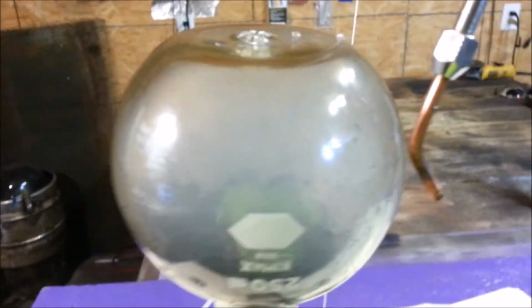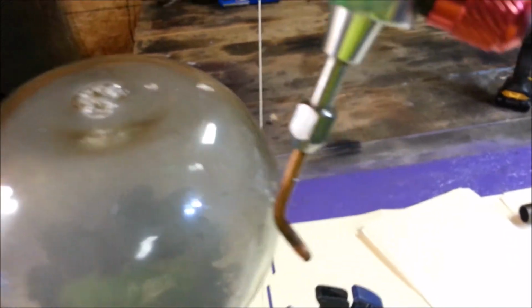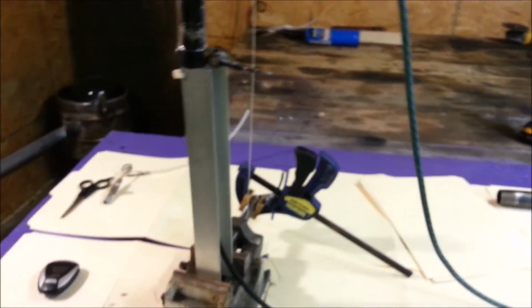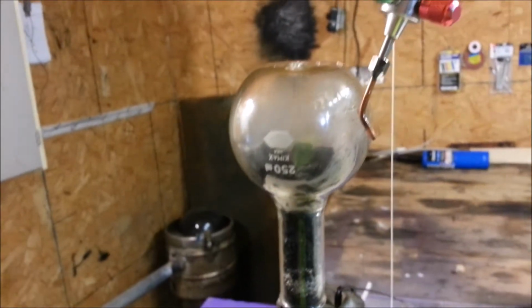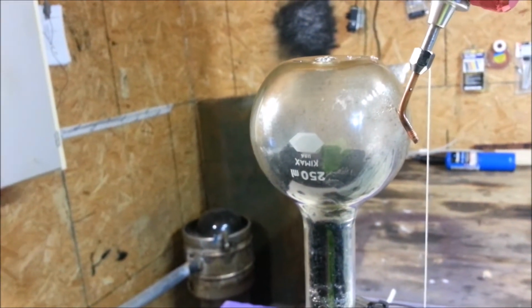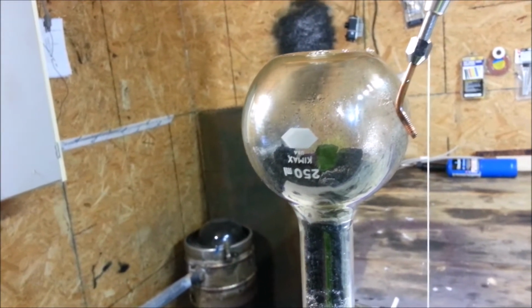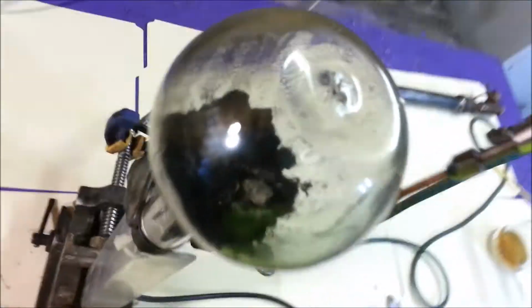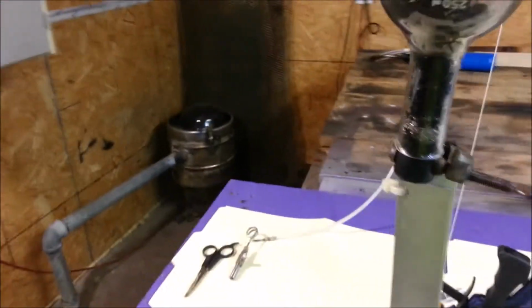So, this is showing some pretty interesting results as far as a device I was planning on building that involved an HHO torch that was injected into a canister full of rubbish or like some sticks or something. This is showing that that doesn't work as easy as I think it's going to. I probably need to turn the power up the very second I stick that flame in there. I'm going to try and do that this time. But I'm going to have to run, evacuating all that HHO. So this time I'm going to stick it in there and then hurry up and run over there and turn it up to full power. Maybe that'll work. I don't know.